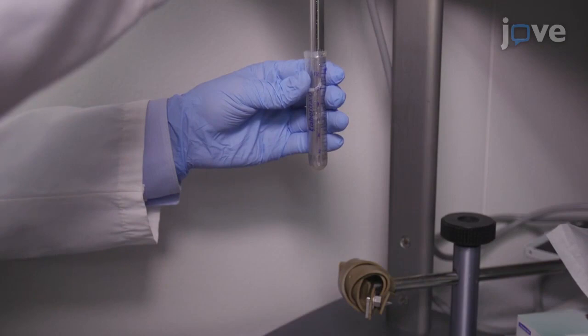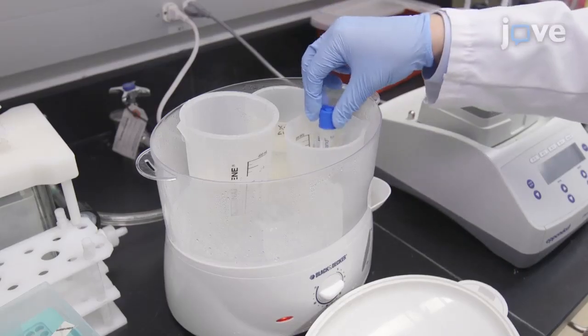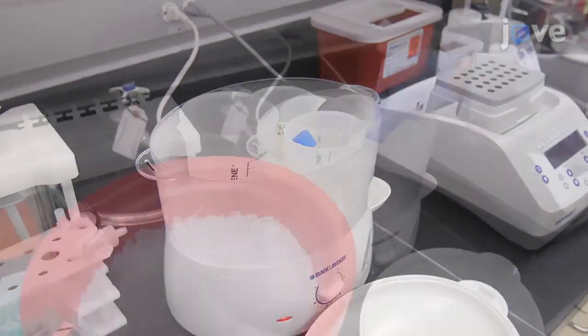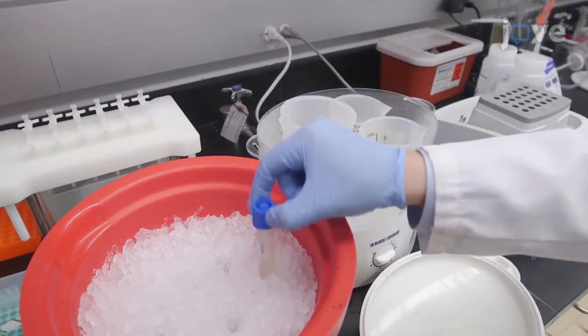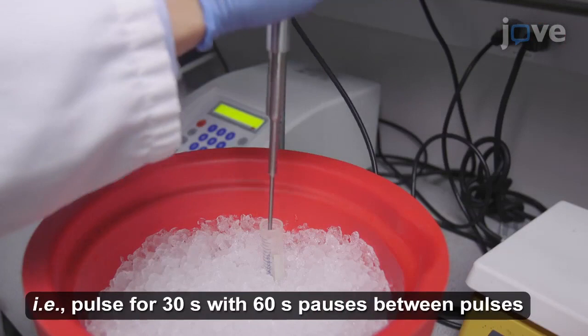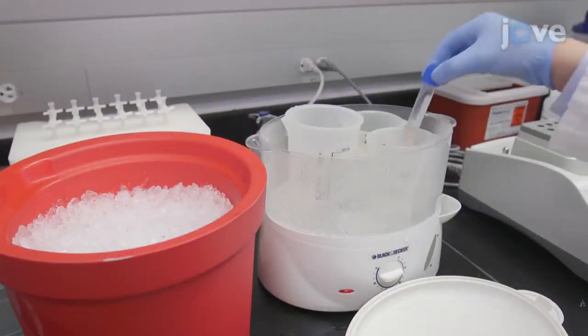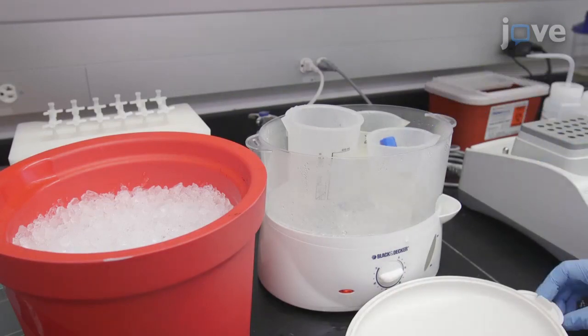To reduce and alkylate the sample, heat the tube at 95 degrees Celsius for 5 minutes, then cool the sample on ice for 15 minutes. While still on ice, sonicate the lysate 3 times. Then, heat the sample at 95 degrees Celsius for 5 minutes.